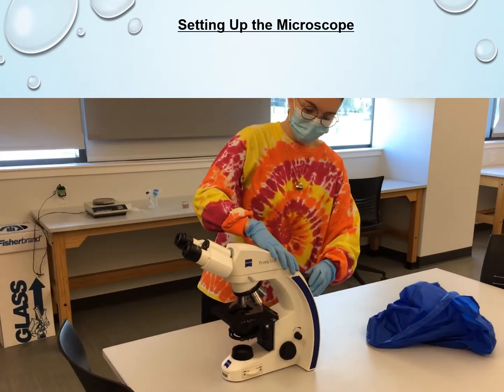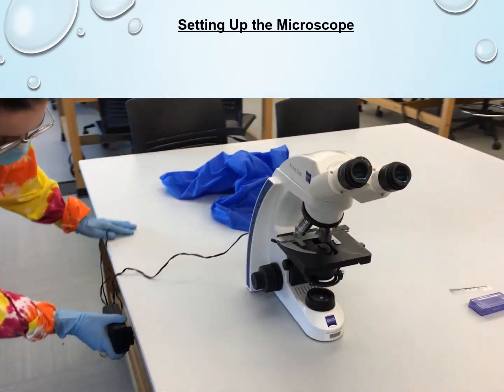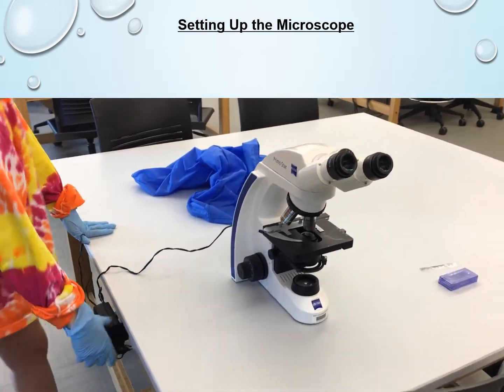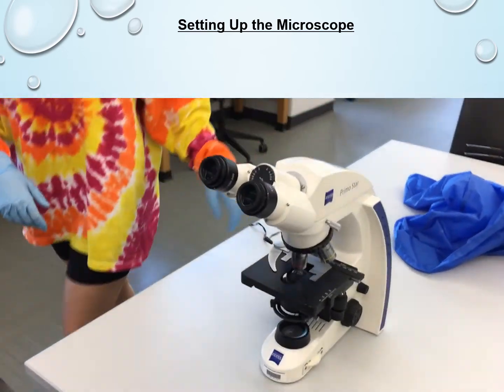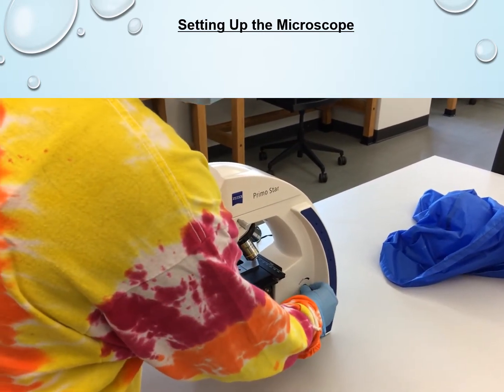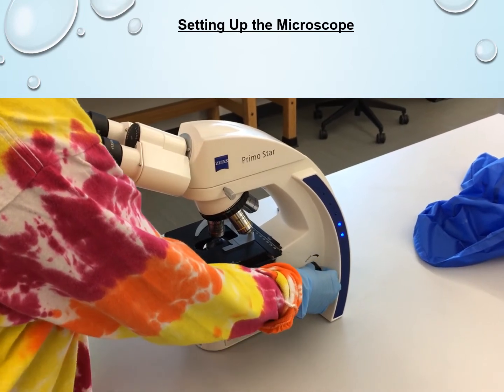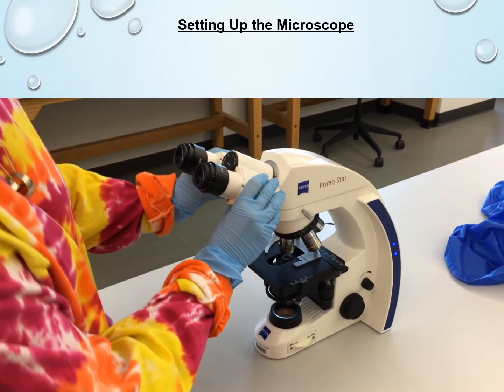She's now removing the cover and then plugging the microscope in. You'll notice that the power cord is actually tucked behind the microscope, so make sure you wrap it up and tuck it behind the microscope again for storage. The on-off switch is on the right-hand side of the microscope, and the same switch also controls the intensity of the light. Make sure to put the light on the lowest intensity that allows you to still view the image, but it's not so bright that it's hurting your eyes or hurting the specimen, especially if you're working with a live specimen. So the lower the intensity, the better.